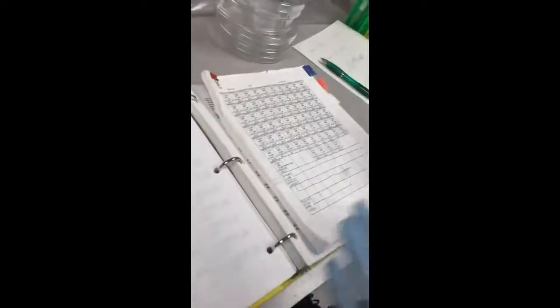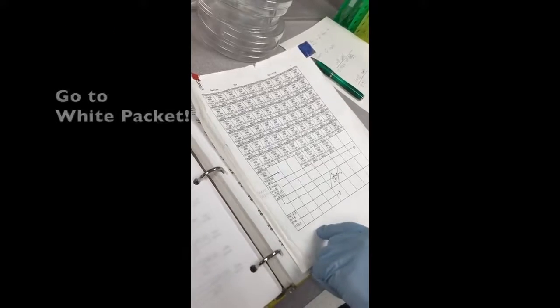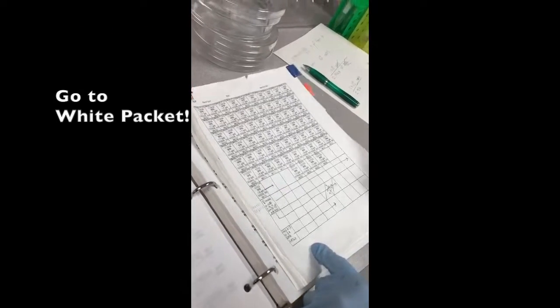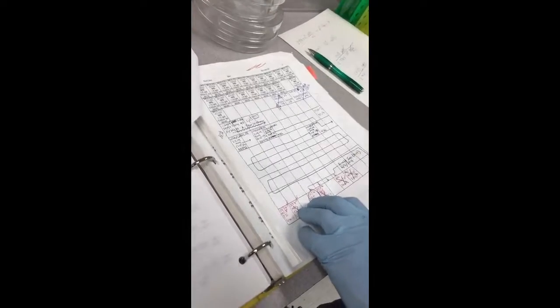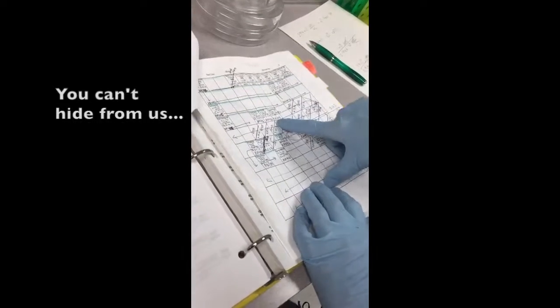Here is a map of our liquid nitrogen freezer space, and so we're going to find AA394. Since the book didn't have the location, this is just going to be a hunt. I think it was in this area someplace. Here we go — AA394.